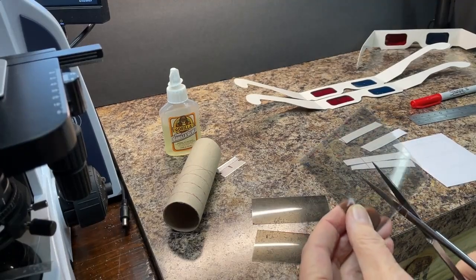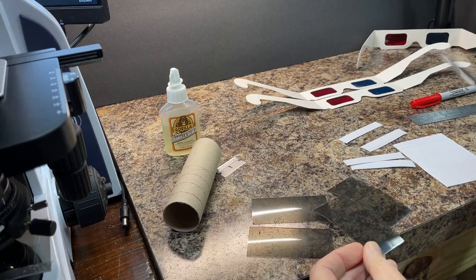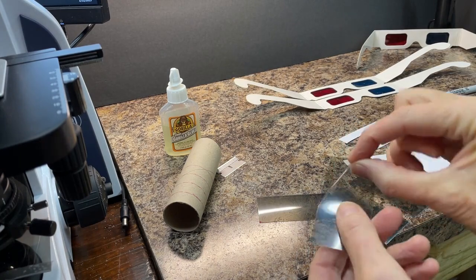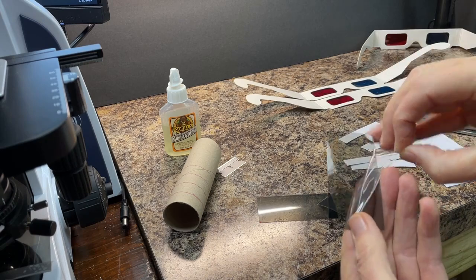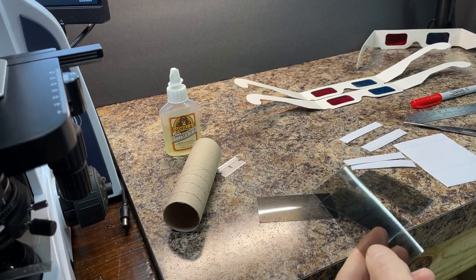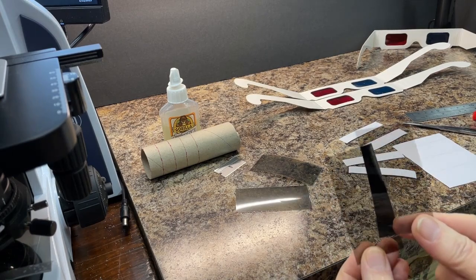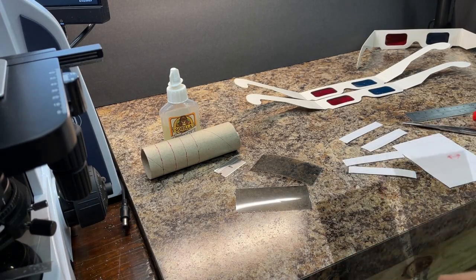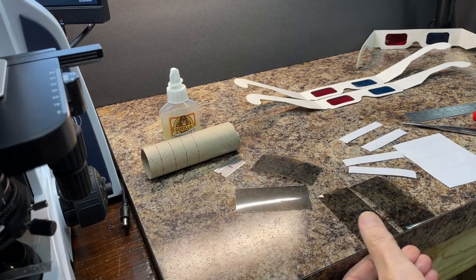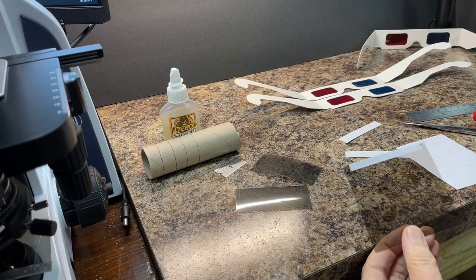For the illuminator filter assembly, cut 2 pieces into rectangles the same size but opposite orientation. Remember to remove the protective film from both sides. Tape them together edge to edge and mark them to show the polarization of each side.